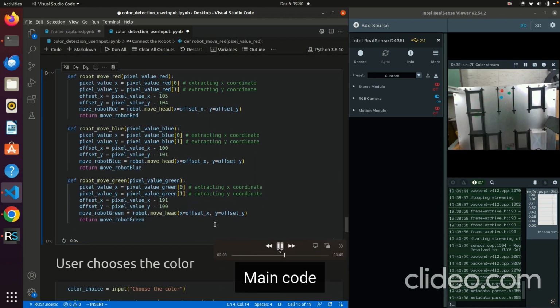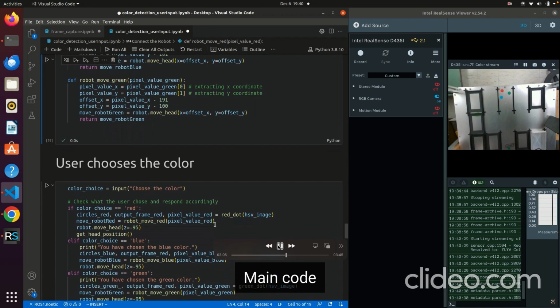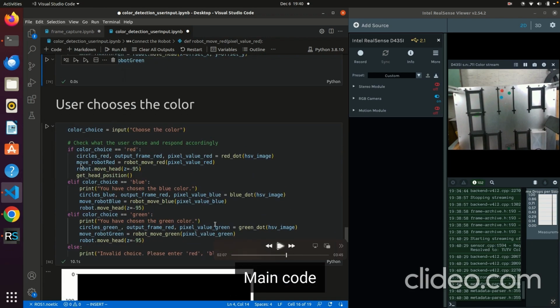Now here in the end you will see all the outputs. Now this is a simple user input if else statement. You're saying if the color choice is red or blue or green, you're returning the detected red circles, the image, and the pixel value, which we will see here. And then if the red is there, display the red color in the image, output frame, and the pixel value, and then move the robot to that red. Then you get the head position, and you move the robot down to touch the red dot by 95 millimeters. Same for blue, same for green.